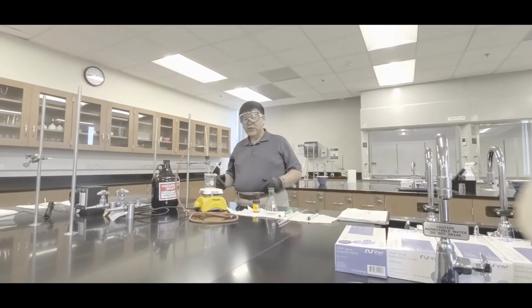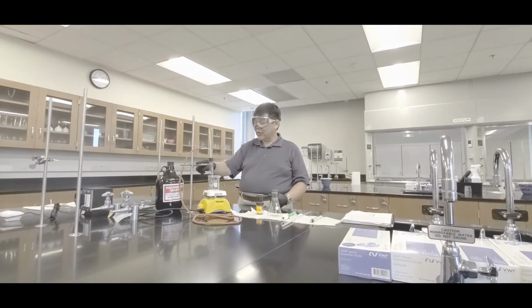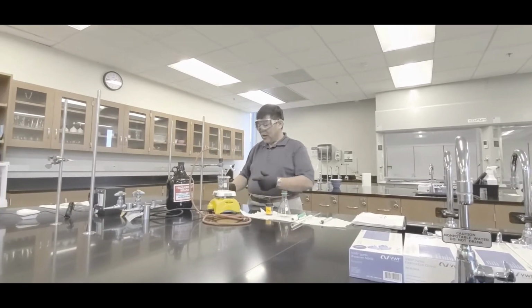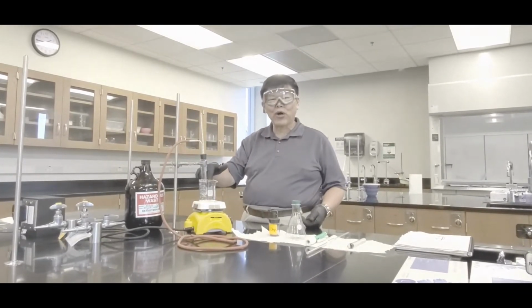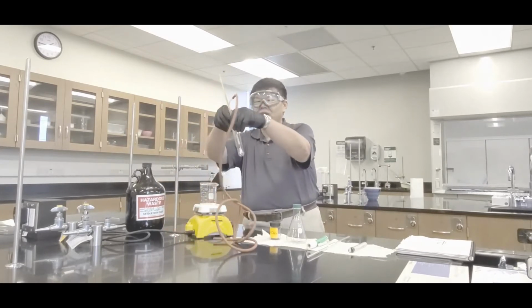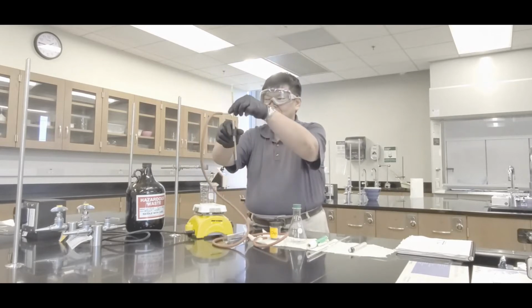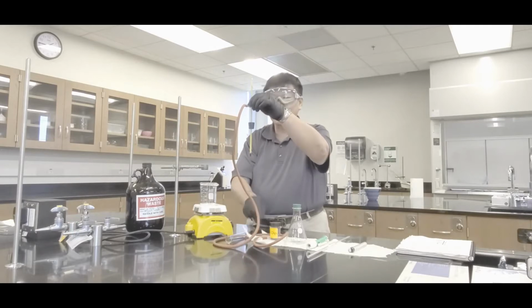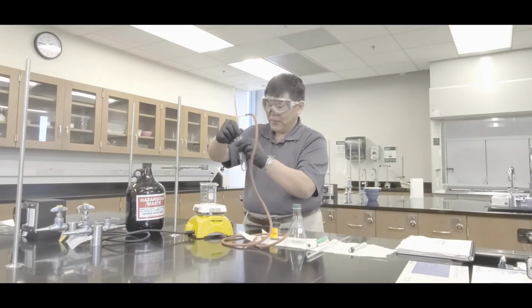Now, for the boiling point determination, you'll need the following. You have a pole right here, and here's a clamp. Go get a hot plate, okay? A hot plate, and a 250 milliliter beaker for putting tap water in for boiling. Then you also have a boiling point apparatus, which consists of a large test tube, and a rubber stopper with a thermometer, an elbow with a hose. There's your boiling point apparatus, okay? I'll mount it back here, like that.